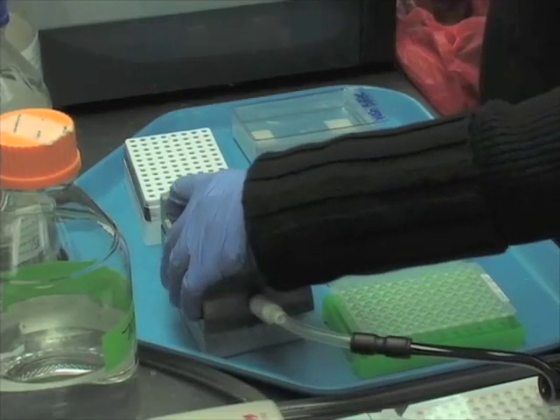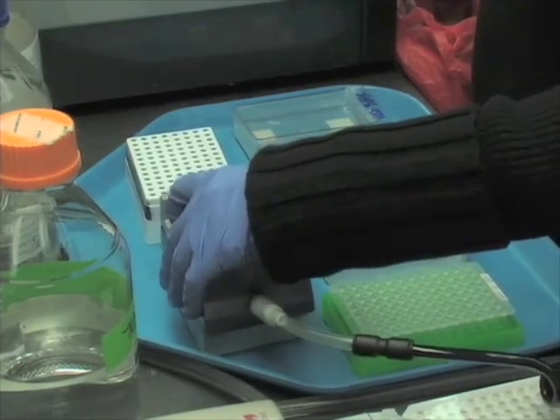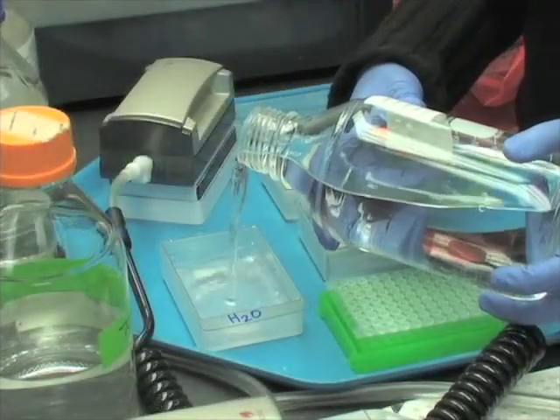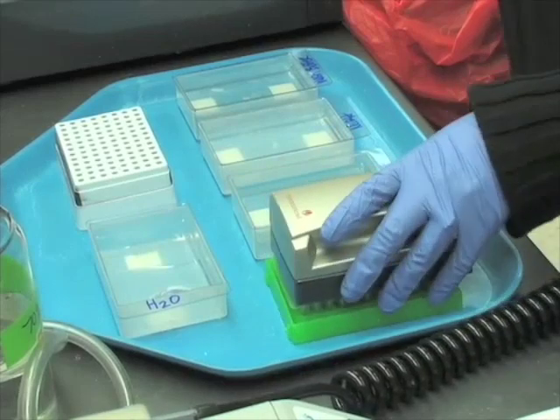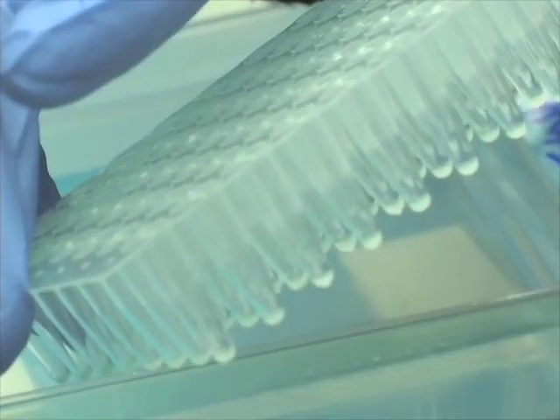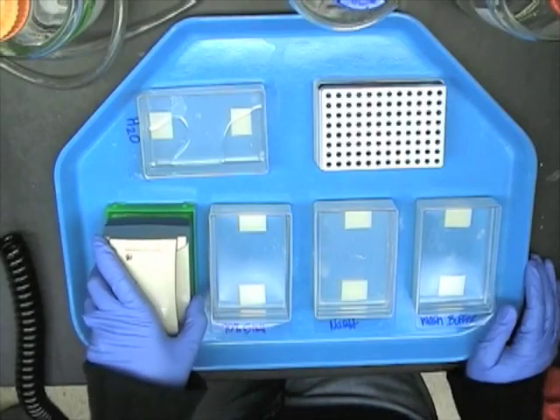Shake the vacuum tool, which is turned off, in clean water to release any beads or debris that may be on it. Discard the remaining water, refill the trough, and turn the vacuum on. Leave the vacuum tool in the trough until all water has been removed, approximately 30 seconds. Place the filter tips of the vacuum tool into the wells of the PCR bead mix plate and let it remain until all liquid has been removed. Gentle rocking may be used to prevent surface tension.